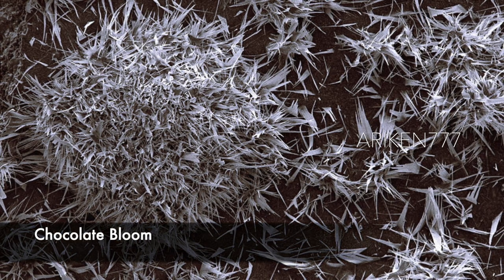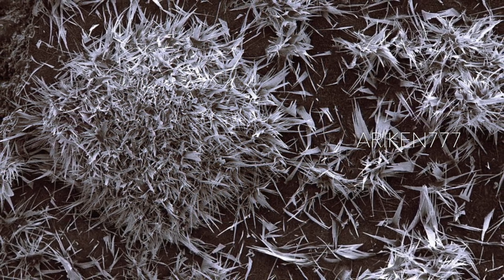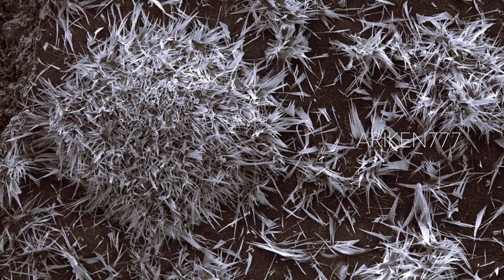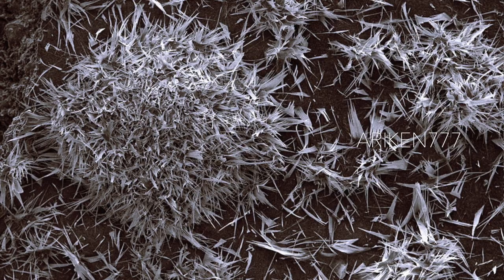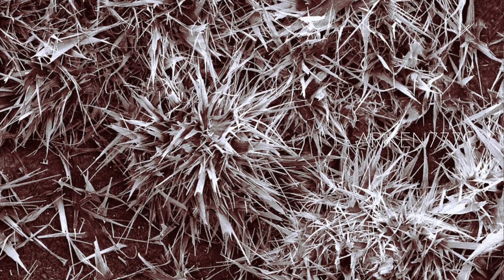The whitish discoloration on the surface of some chocolate confections stored for long periods of time under unfavorable conditions is called a bloom. Sugar bloom develops by sugar recrystallizing on the surface of chocolate due to moisture. Fat bloom consists of fat crystals developing from cocoa butter used to make chocolate, particularly if the chocolate is stored at an elevated temperature. Both kinds of bloom differ in the appearance of the crystals.